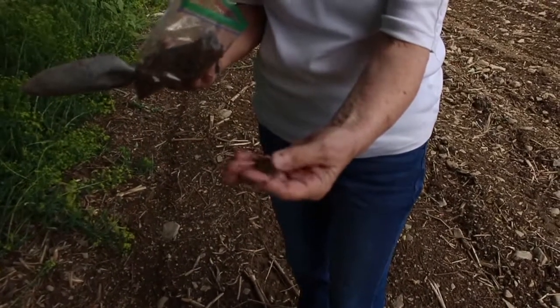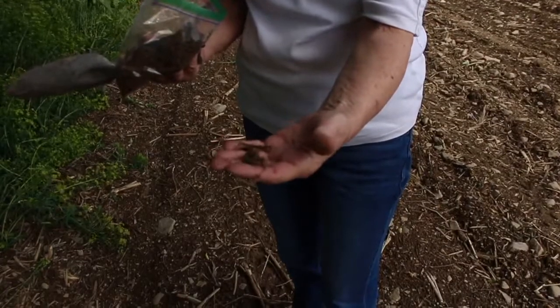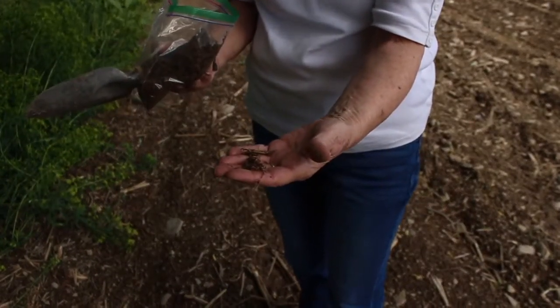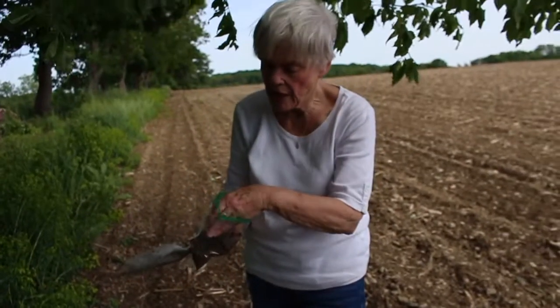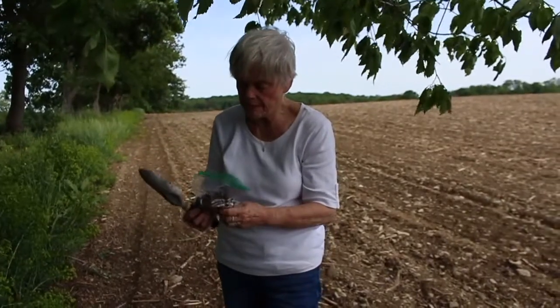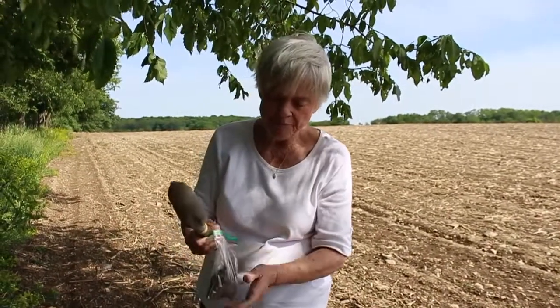When you have little roots like this, if they're dead, they probably aren't still colonized by microbes the way they would be if they're alive. But still, we're going to be measuring this soil, so I usually mix it up a little bit. Now this is going to have to be sifted because I have some rocks and some debris and stuff like that, so when I get to where I'm going to test I'm going to sift those out.